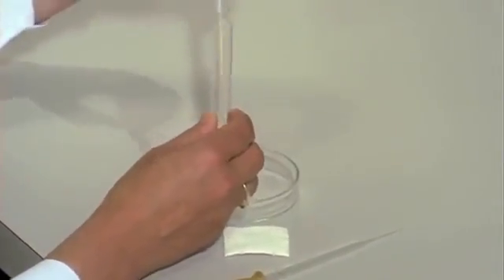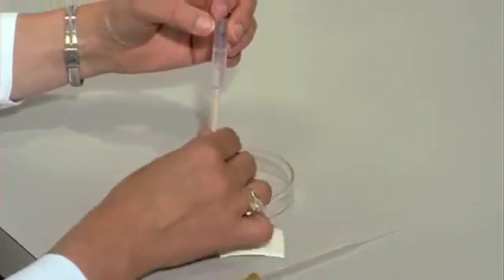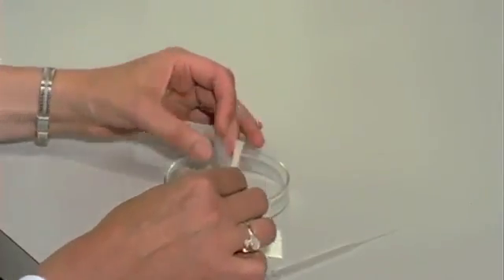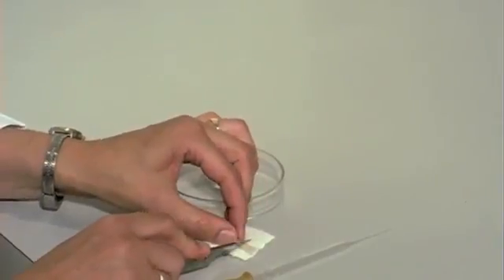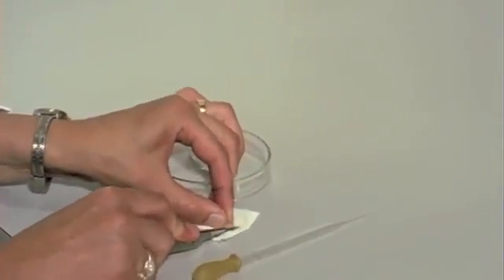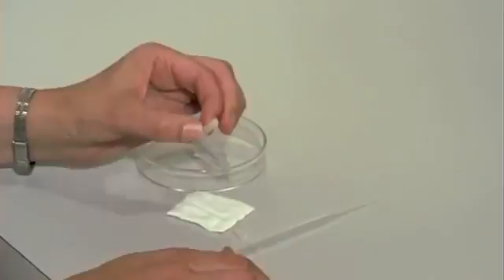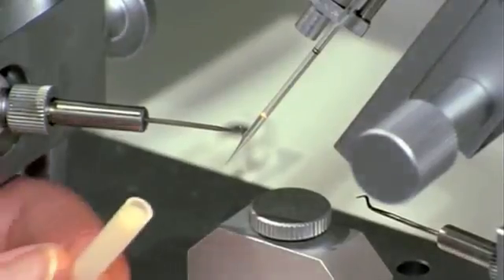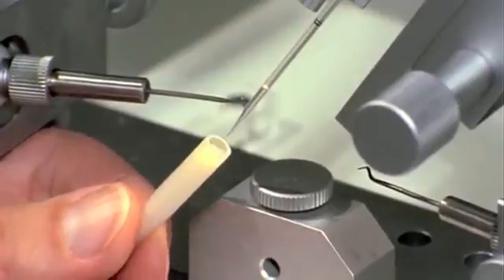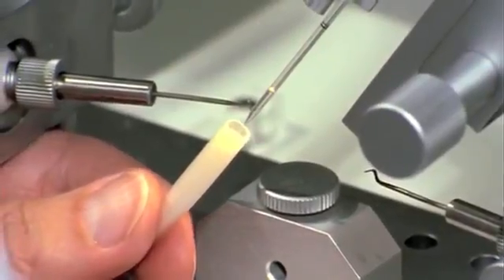The clear supernatant is removed and the plastic tube is cut off on a level with the surface of the sperm. The insemination syringe is then filled with the homogenized semen.